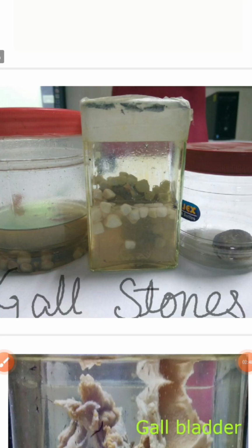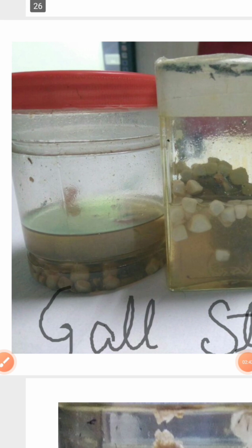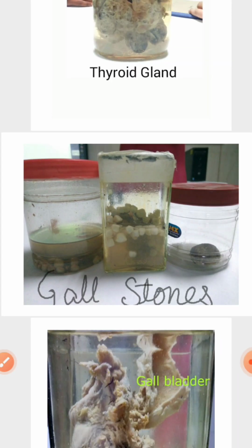Next, they might keep gallstones. There are three types of gallstones: cholesterol stones, pigment stones, and mixed stones. I will tell the difference soon.